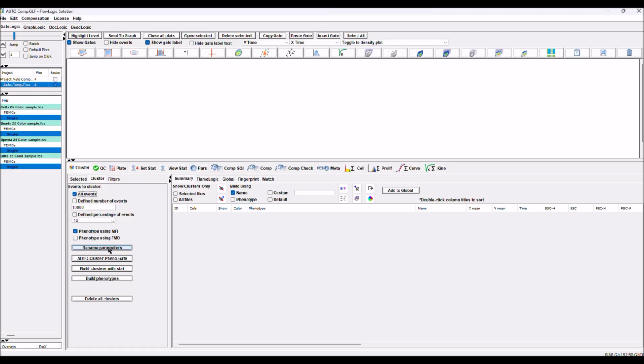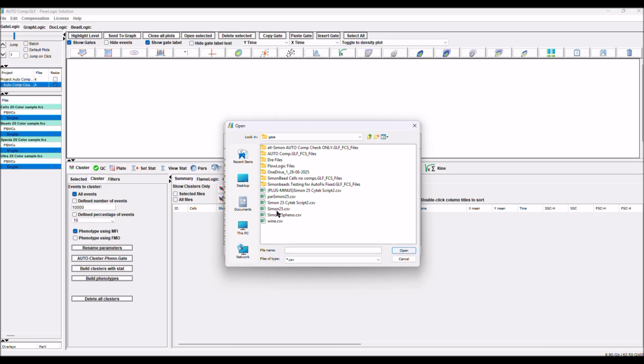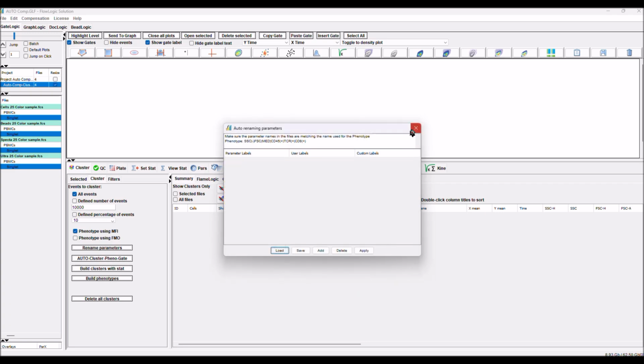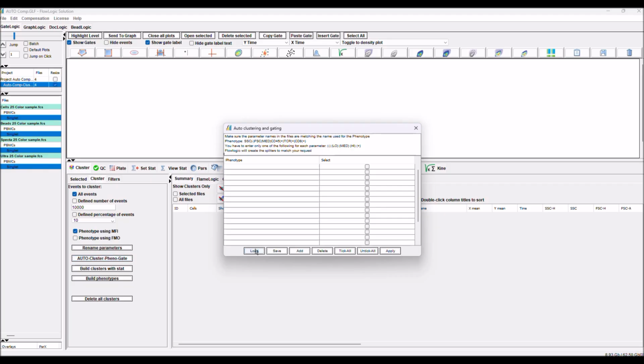So first step, verify the parameters are renamed. If they are not renamed, you can rename them one by one, save for the next experiment, save it and save as a CSV, or load something that you already built. Like in this case, we have already built our parameter CSV. Cancel because we don't need it. And now we are ready to start with the phenotype.